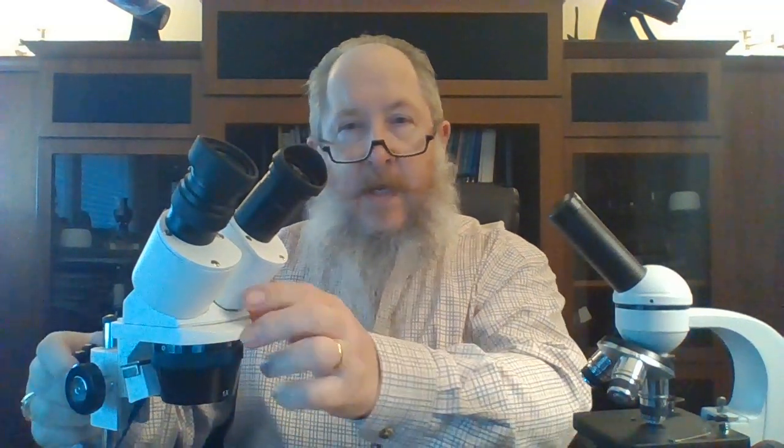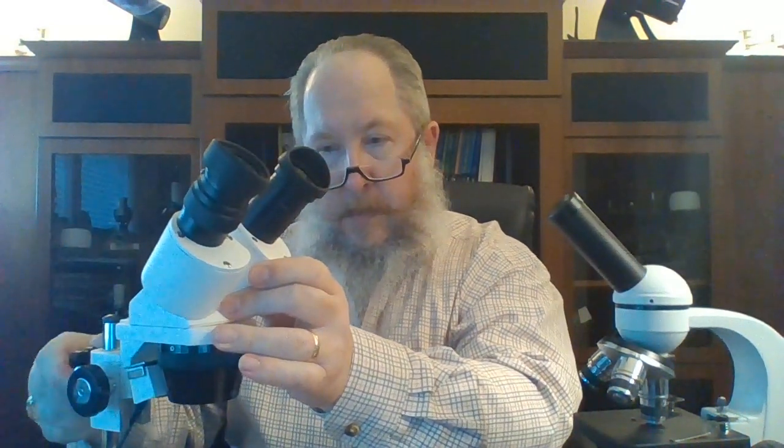Stereoscopes also have an advantage in that they can have greater viewing distances — you'll notice this has quite a large distance between the objective and the viewing platform. They also often have viewing heads that can be rotated completely around. For instance, in those paleontology applications, you can rotate the head completely around so that if you have a large fossil — perhaps a leg bone of a dinosaur — you could position it over the entire bone to see what the markings on that fossil might have been, such as teeth marks from a Tyrannosaurus rex.